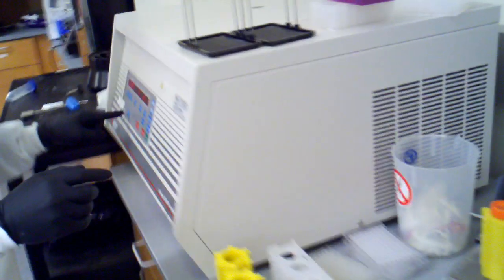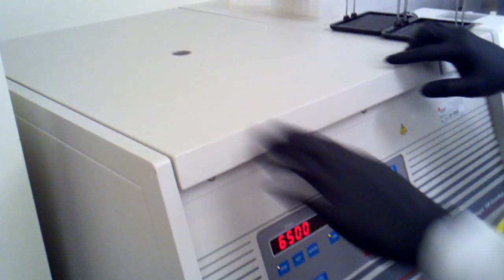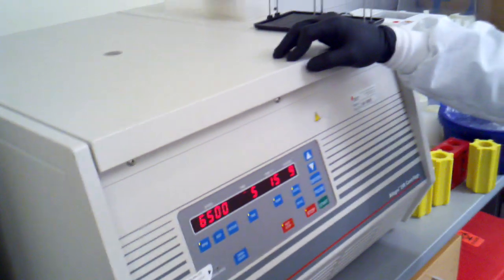So now we're ready to spin. So I hit open. That thing has already been screwed down. And I just balance them opposite one another. And hit start. This is going to spin down.